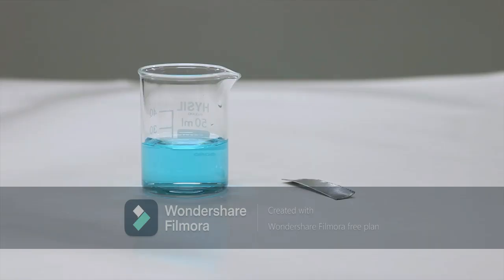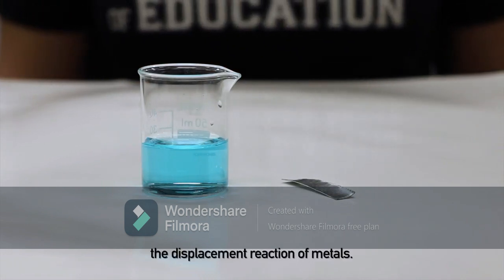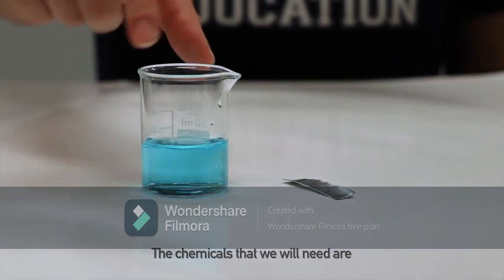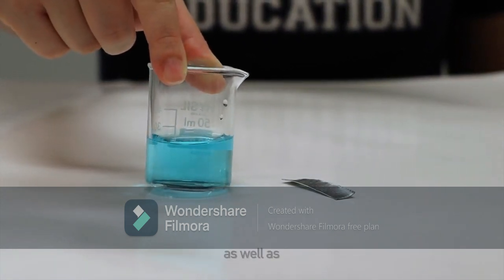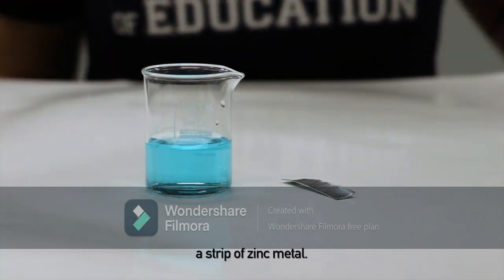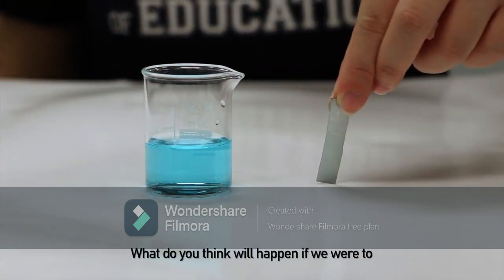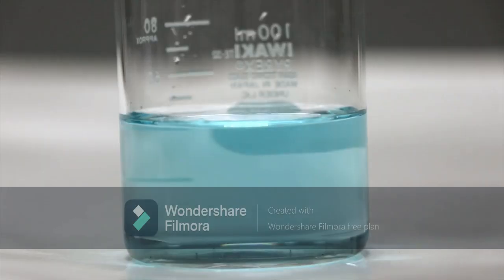Hi students, in today's experiment, we will be looking at the displacement reaction of metals. The chemicals that we will need are a beaker of copper 2 sulfate solution, as well as a strip of zinc metal. What do you think will happen if we were to place this piece of zinc into the solution? Let's find out.